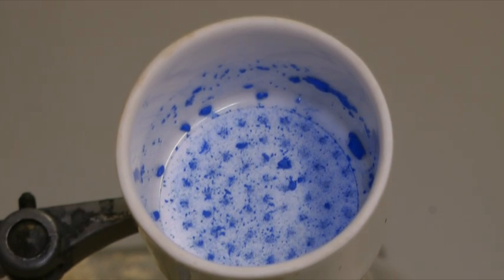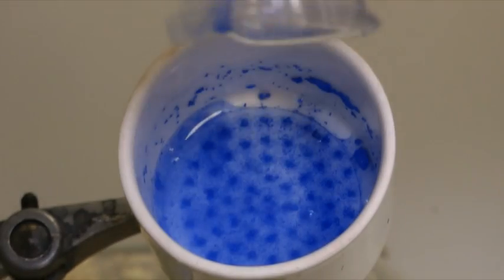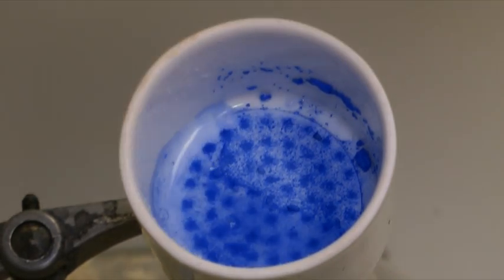The beaker containing the mixture can be rinsed once again. The collected solid can then be rinsed further with distilled water.